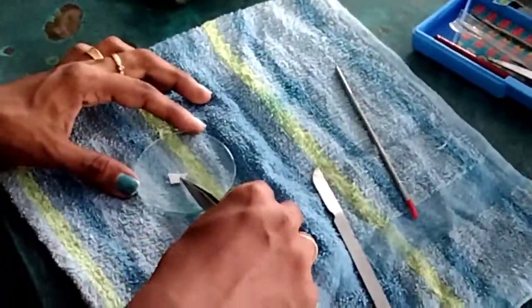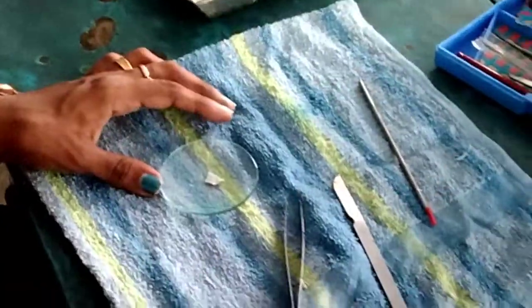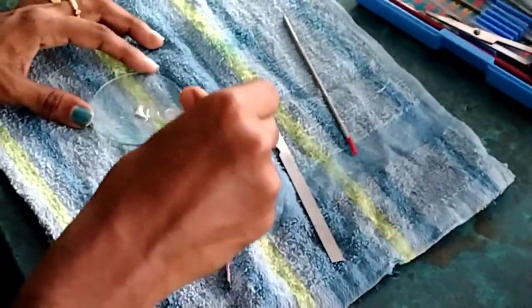So this is the skin which is cleaned. You can add some water and wash it.